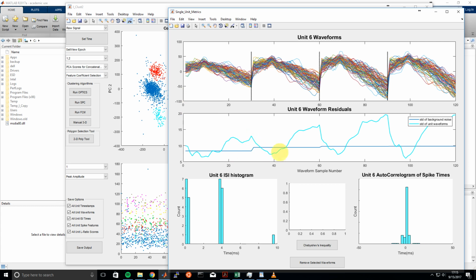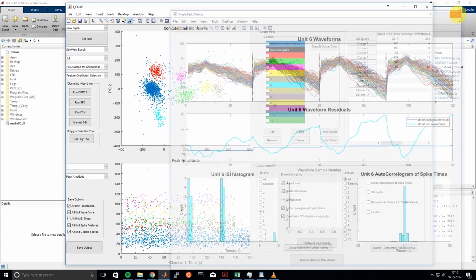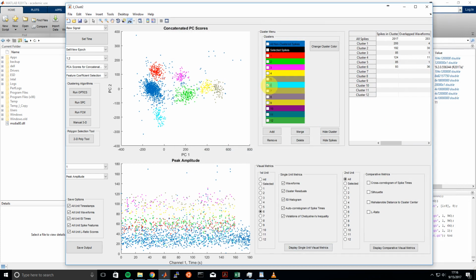The residuals are all over the place. There's variability at all parts of the waveform, which is much higher, almost 2 times higher than the background noise for the channel. There's a bunch of refractory period violations, so ISIs that are less than 1 millisecond, a total of 12 for this particular unit. So we can just get rid of this unit right away. We can see that this is erroneously clustered. It might have just been a noise cluster, some noise artifacts, so we'll delete that.